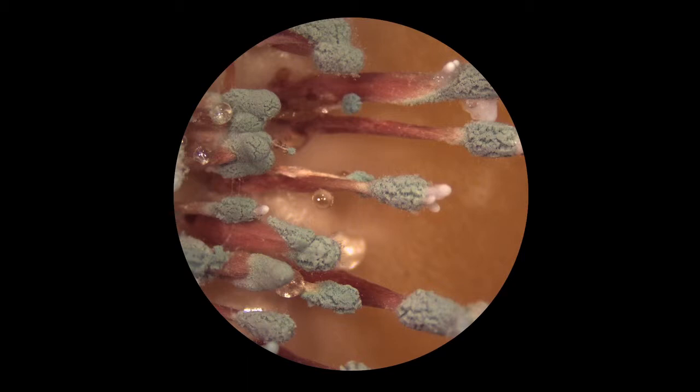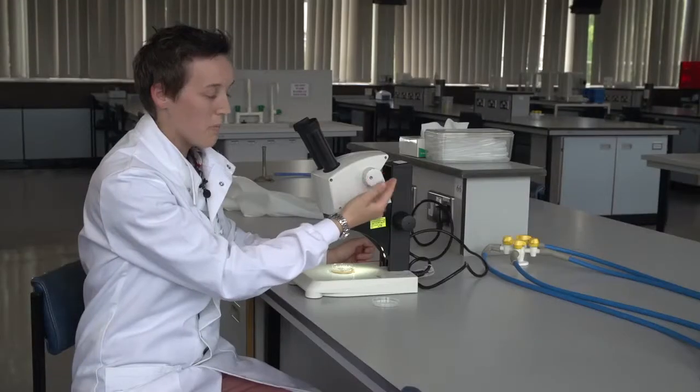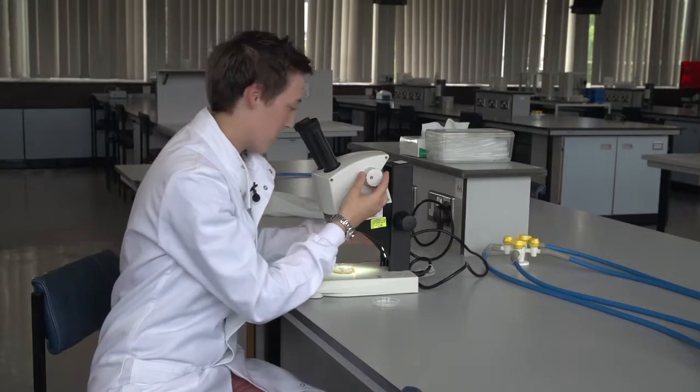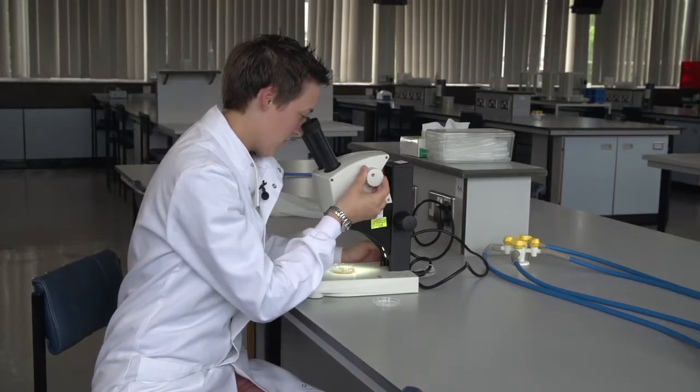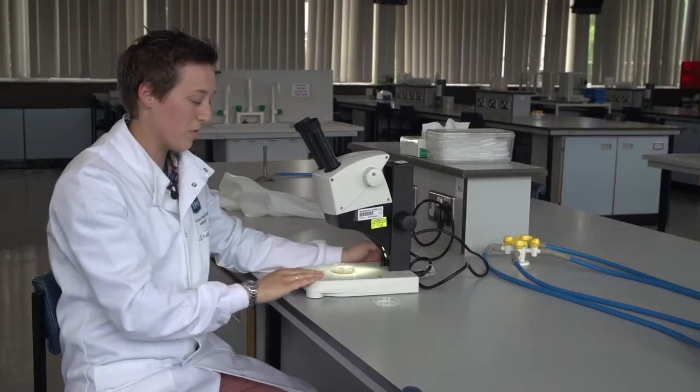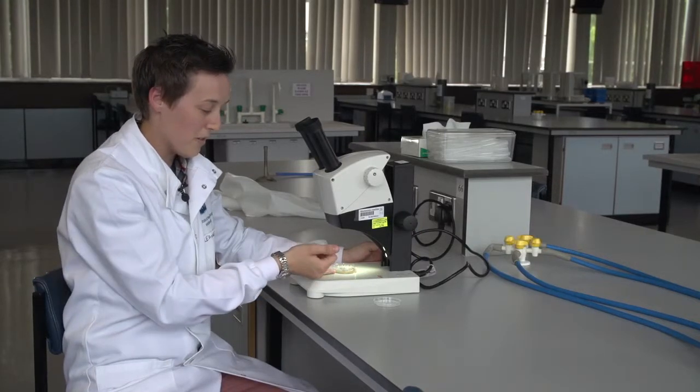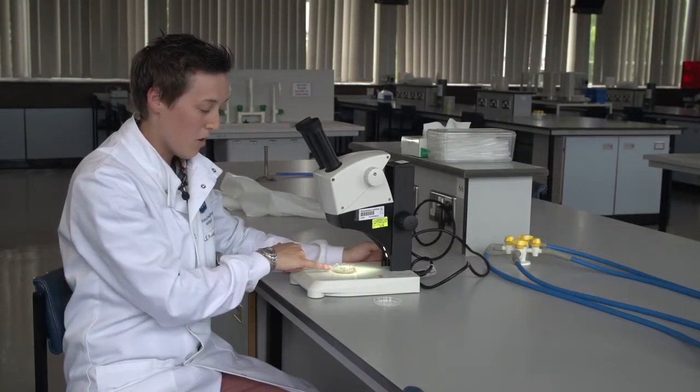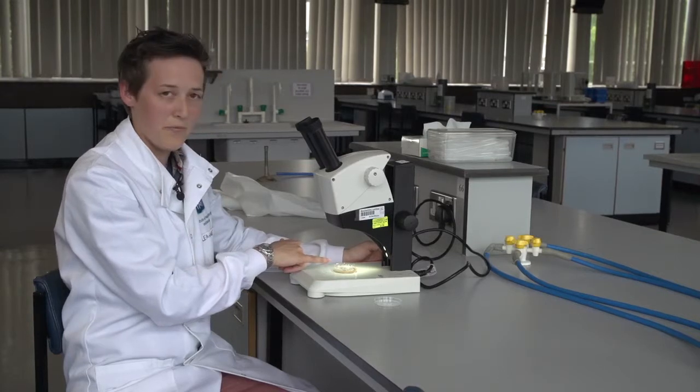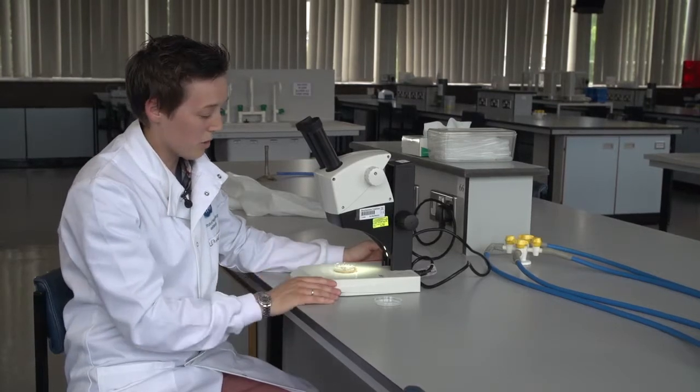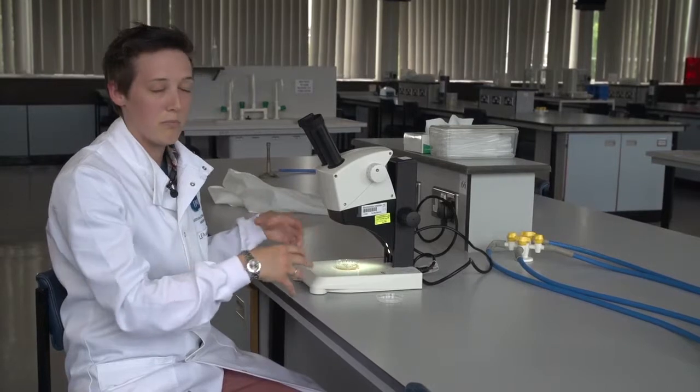Now that I'm happy with that I can then move up in magnification and change the focus as I go. Doing this I'm able to focus at the very base of the morphology of the fungus all the way up to the very tips, and this is a very good microscope for looking at large macro structures.